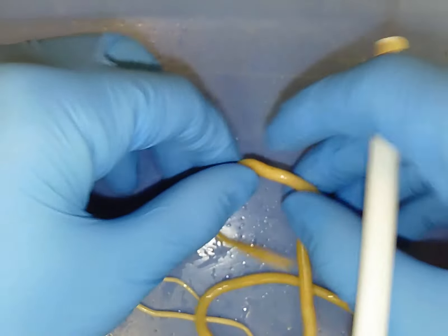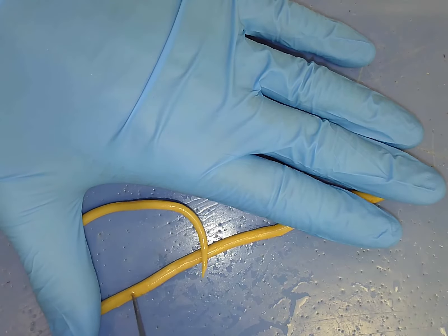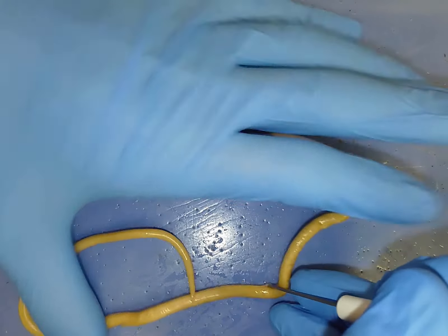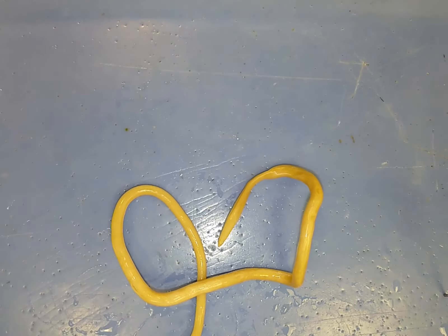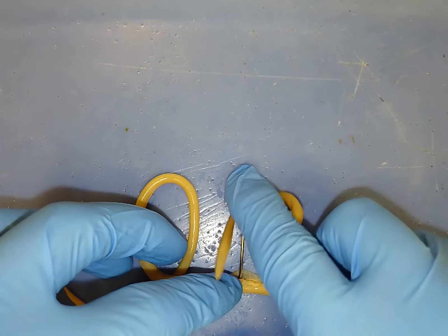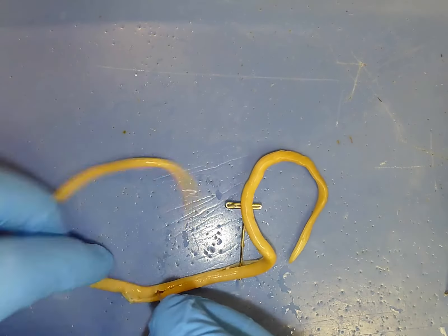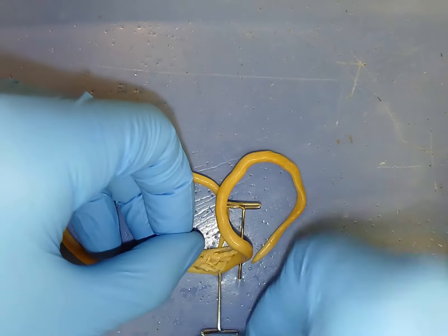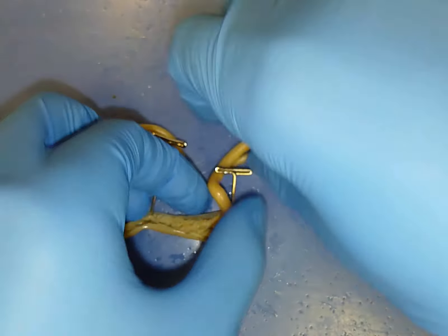I'm going to cut open this nematode — you guys deserve a good video. As you can see, the cuticle is very thin, much thinner than what you saw in the earthworm; it takes a fraction of the time to cut open. I'll grab a couple T-pins and start splaying open this organism. When you're putting in a T-pin, put it in at a very sharp angle so you have enough room to work with your hands — put it all the way down on its side and then insert the pin down. I'll work my way down the length of the body on either side, just spreading it open with the teasing needle.